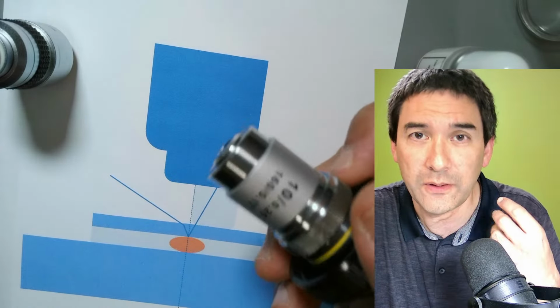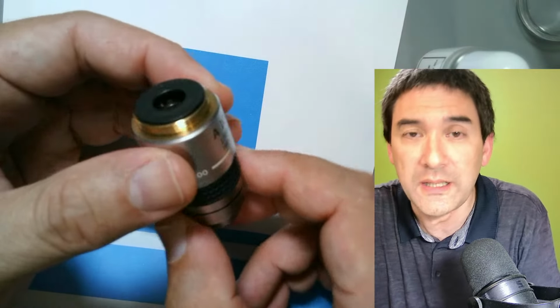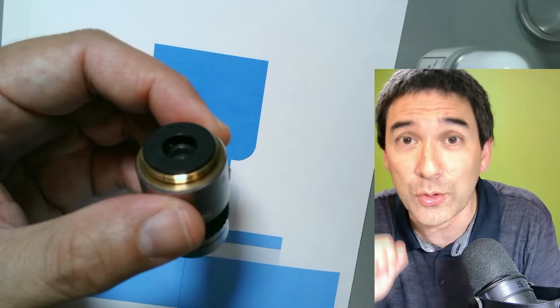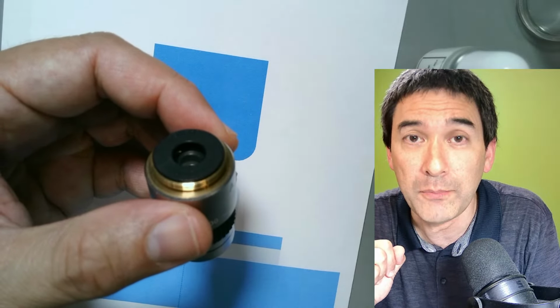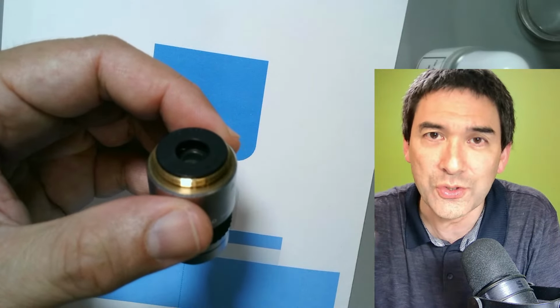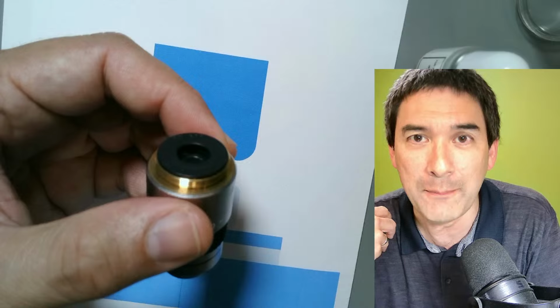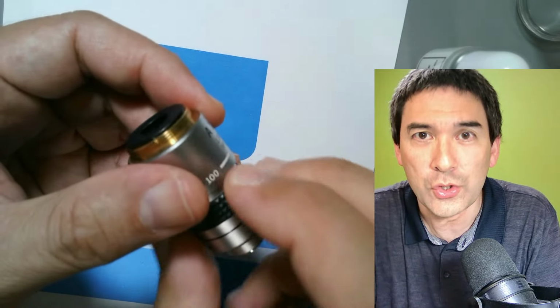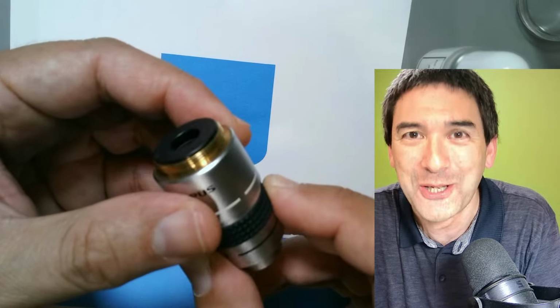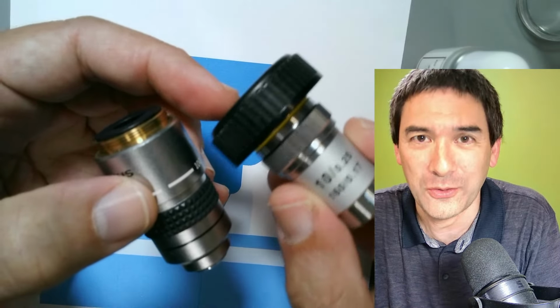If you use oil immersion and you're observing the specimen, and then you change the magnification back to a lower one, let's say 60 times or 40 times, because you're not thinking or you just forgot, then you rotate the 40 times or 60 times objective into the immersion oil as well. This can happen very quickly. So once you've got the oil on the objective, do not change magnification anymore, otherwise you end up messing up your objective.